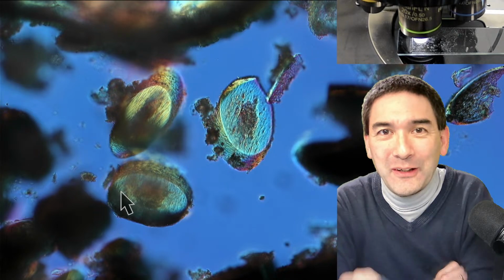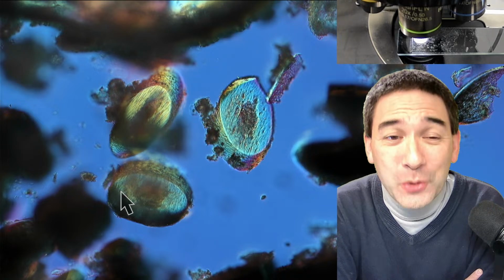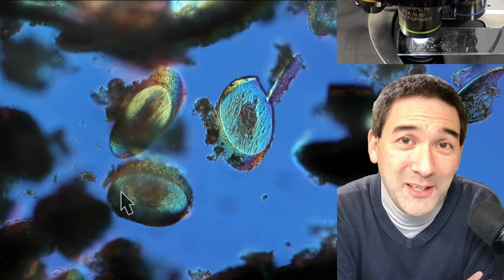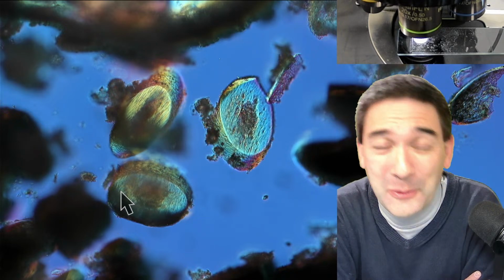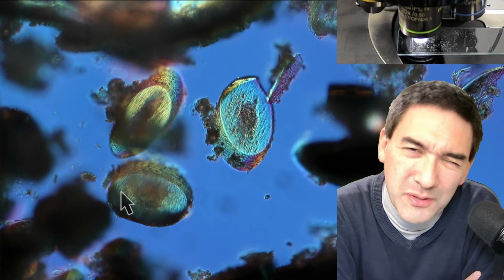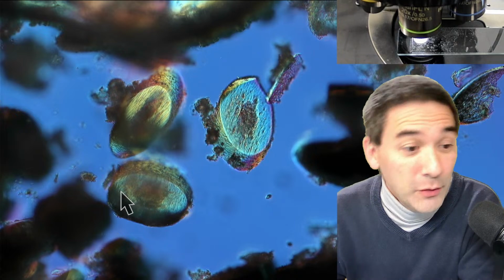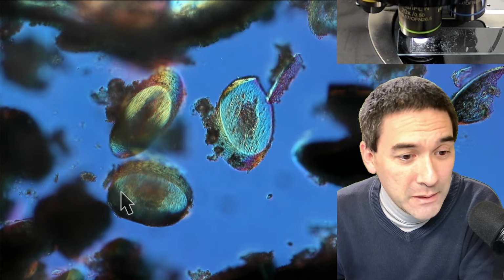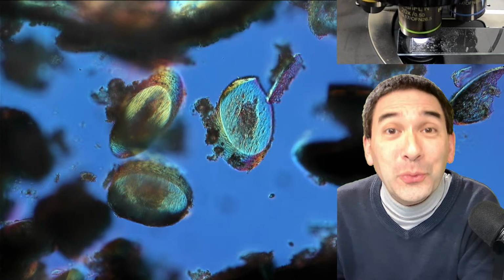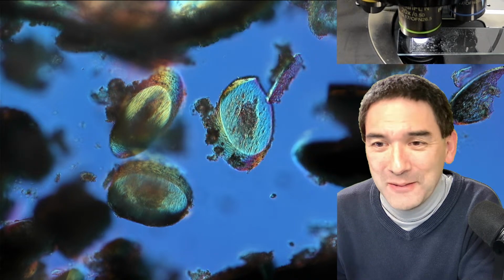First of all, thank you very much for joining in again on a Saturday to a microscopy live stream. Today's topic is maybe a little bit unique, a little bit different. I decided to put some hair under the microscope, and I've come up with a couple of little demonstrations as well. I would like to show you some hair under the microscope, not only my own, but also some hair that, thankfully, some of my students donated to me yesterday. So we're also going to have a look at that.